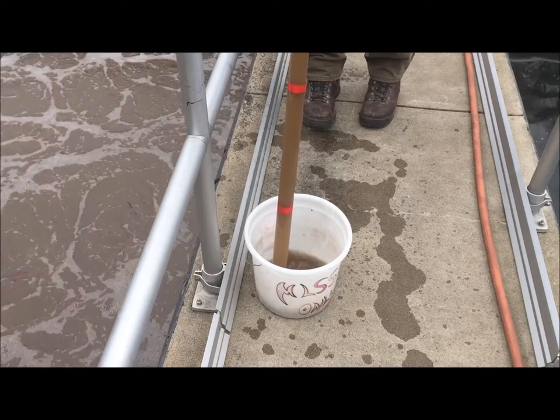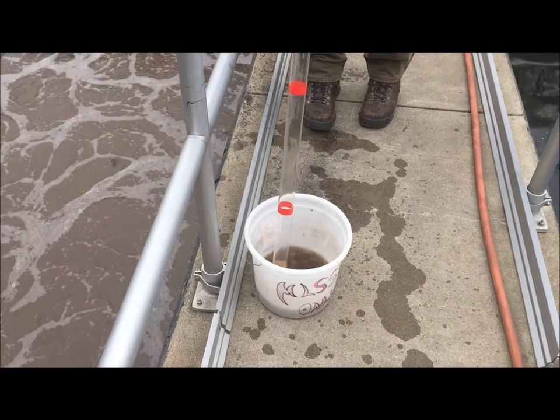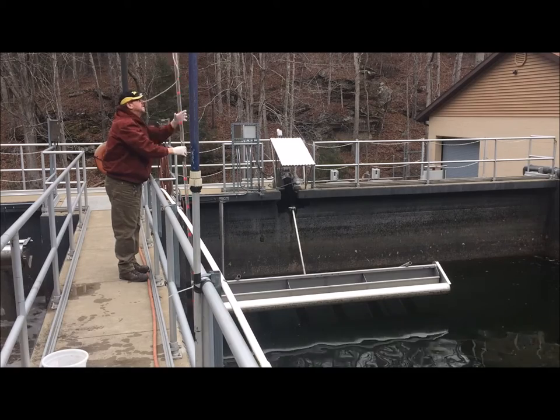Here a well-mixed sample is taken during the last air cycle from aeration basin number two. The tool here being used is called a core sampler, commonly called a sludge judge.